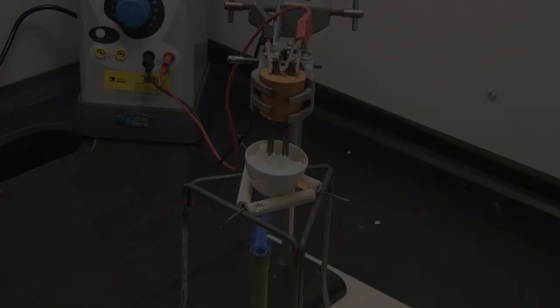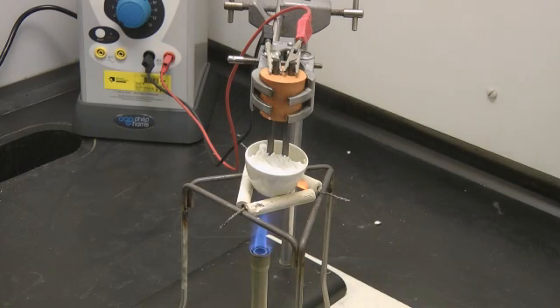Lead bromide is a solid at room temperature. Before performing electrolysis, we first need to melt the lead bromide by heating it in a crucible with a Bunsen burner.